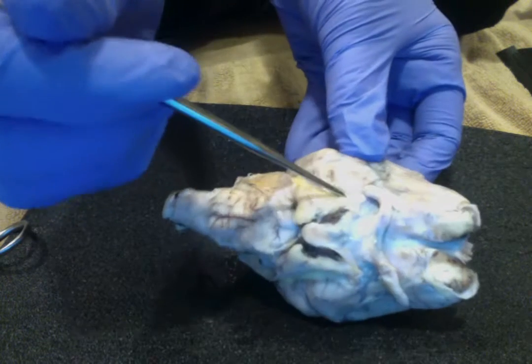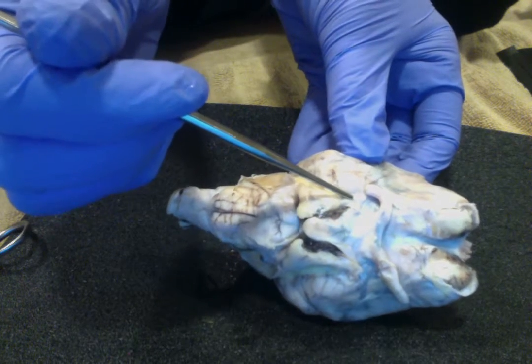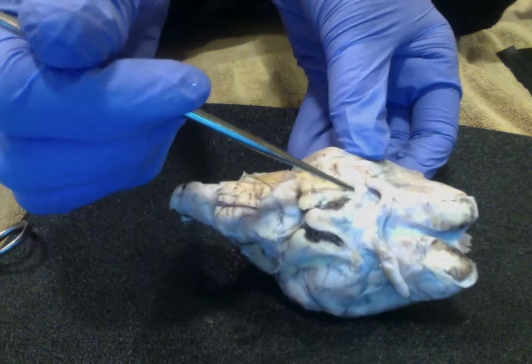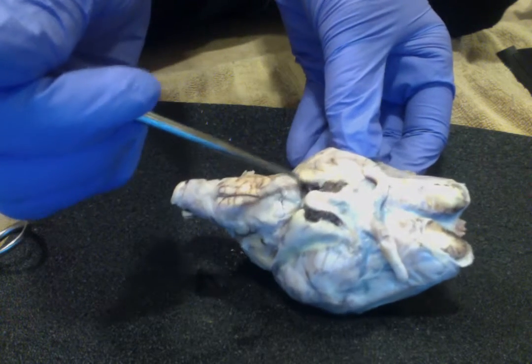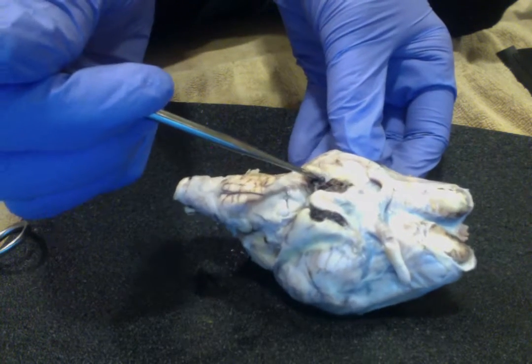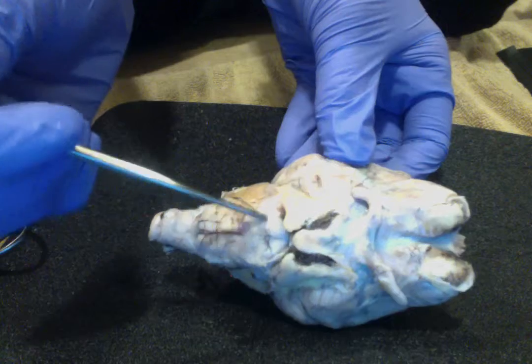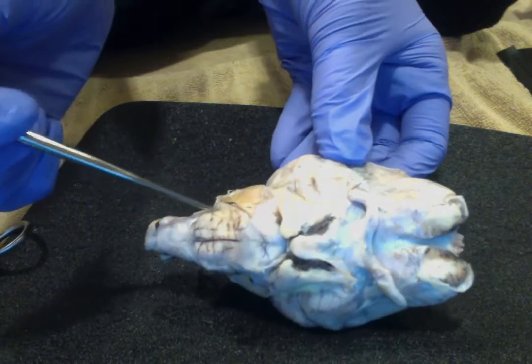This is the midbrain. These are meninges. This is the pons. Medulla oblongata.